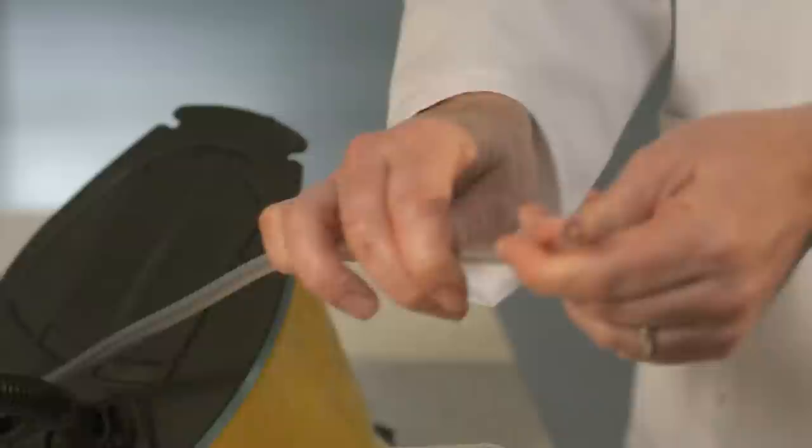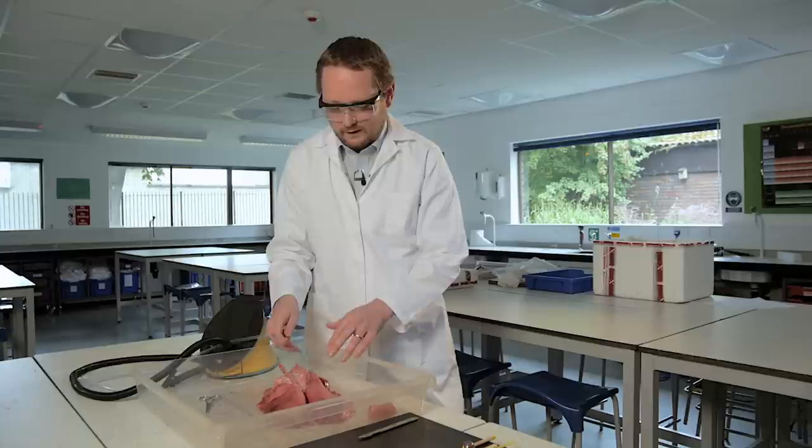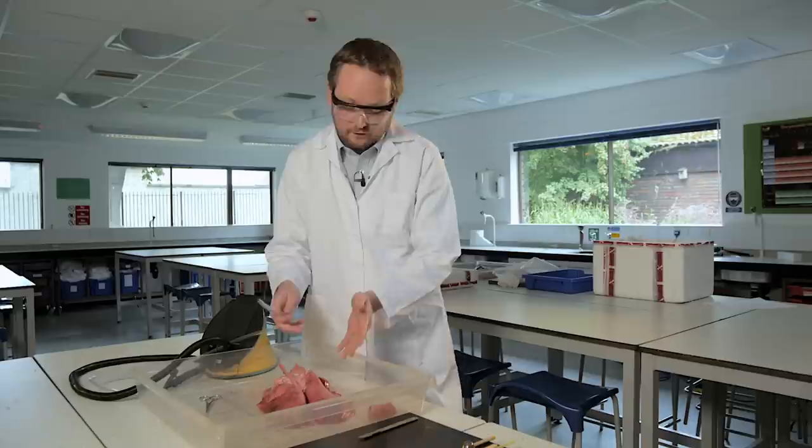This is a standard foot pump that is used to inflate air beds. We've attached a plastic tube to it that's an appropriate size. I prefer to use a pump rather than blowing into it because you don't know what kind of matter you're going to eject as the air comes back at you. The lungs have an elastic recoil, which is actually how we breathe out. And I don't want them elastically recoiling and pushing blood or whatever mucus back into in my direction.